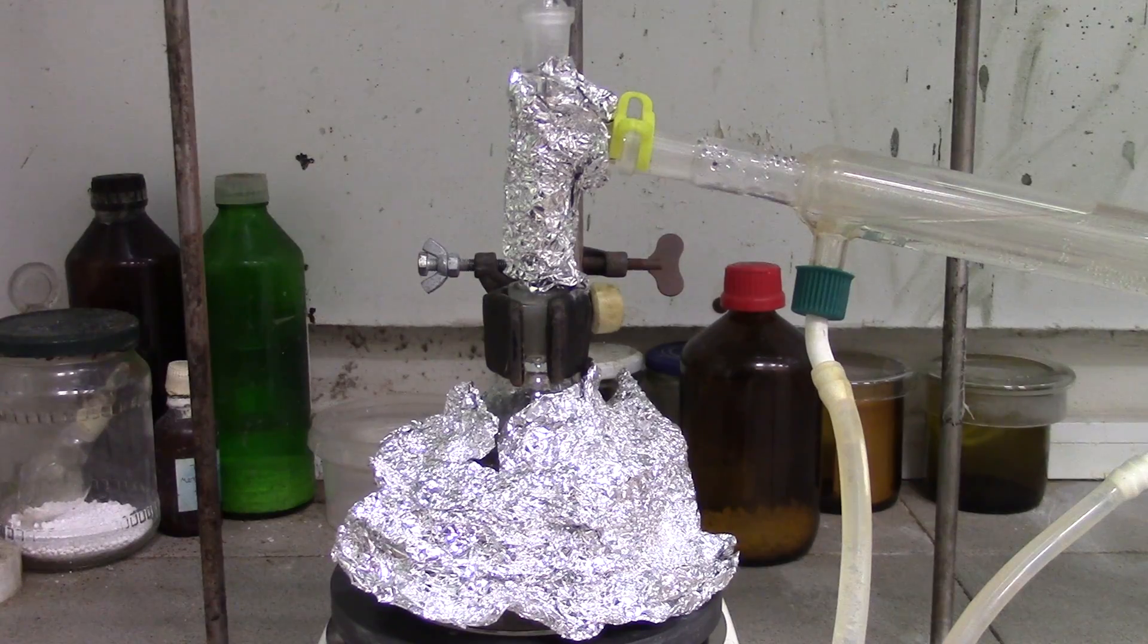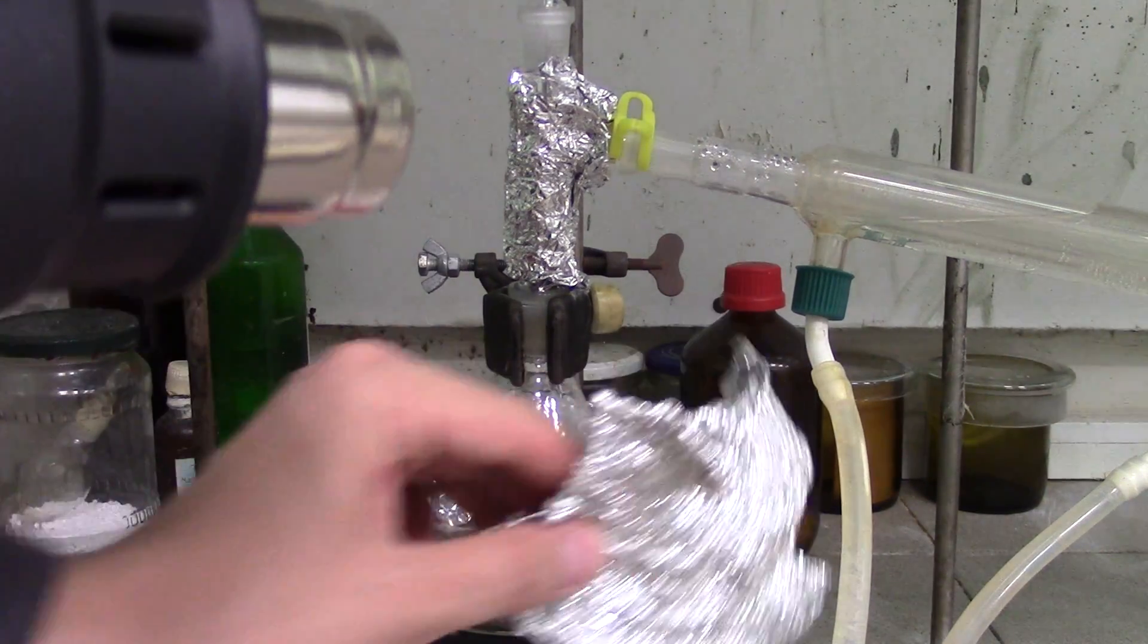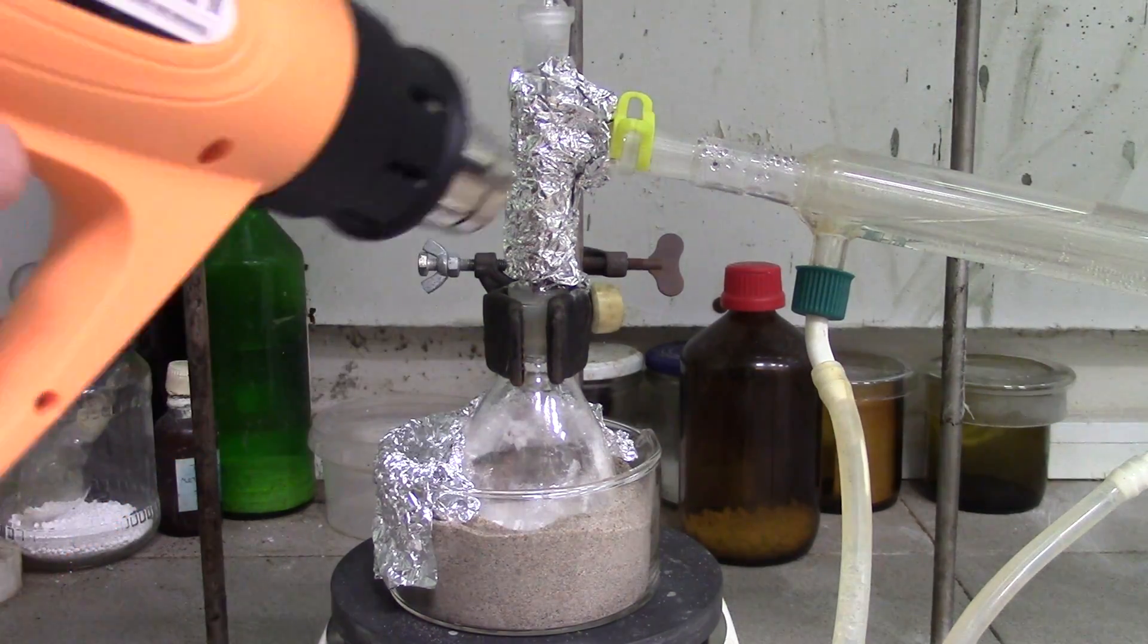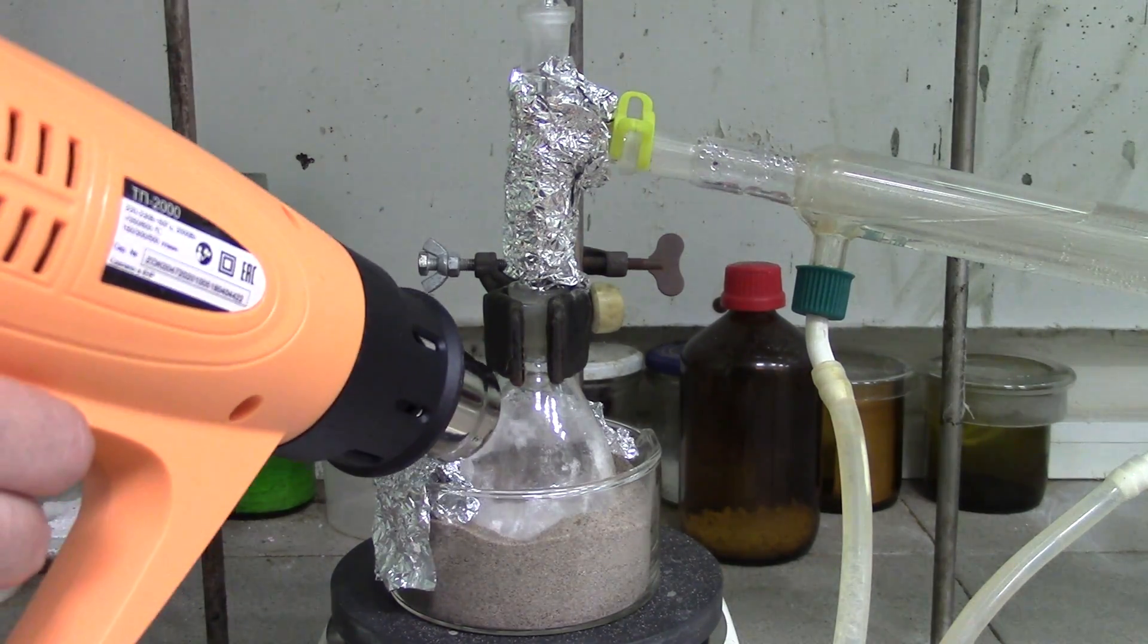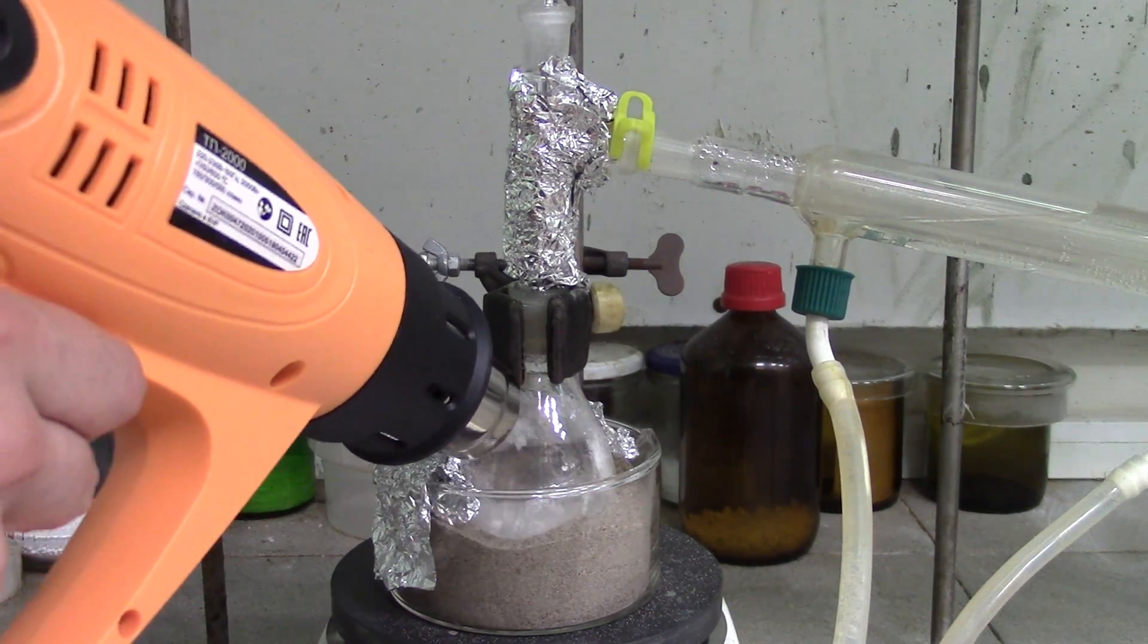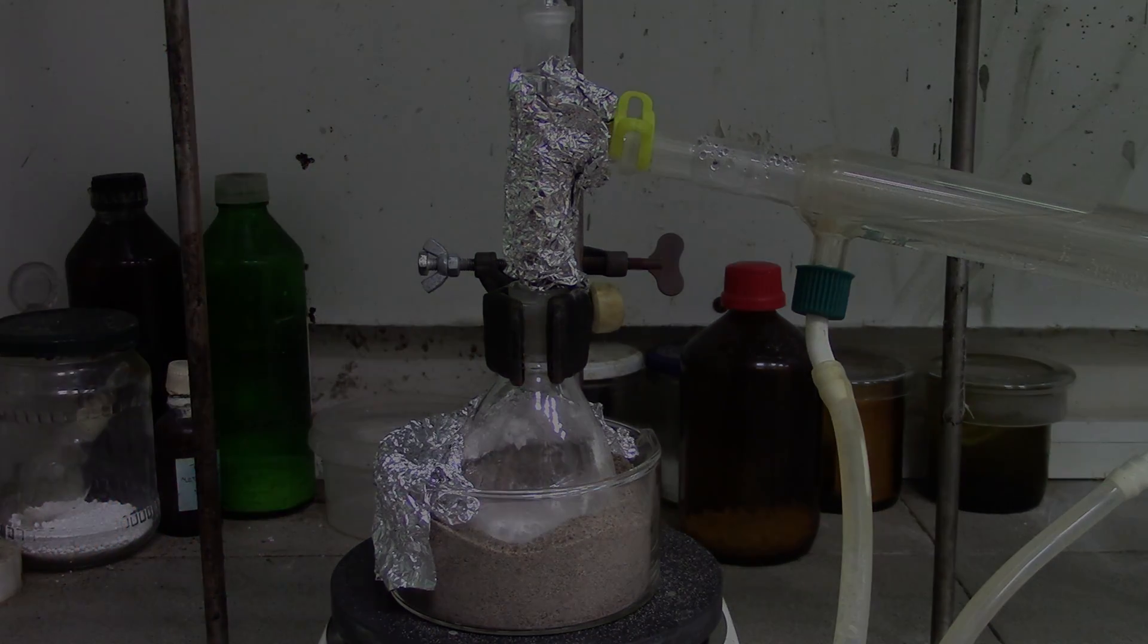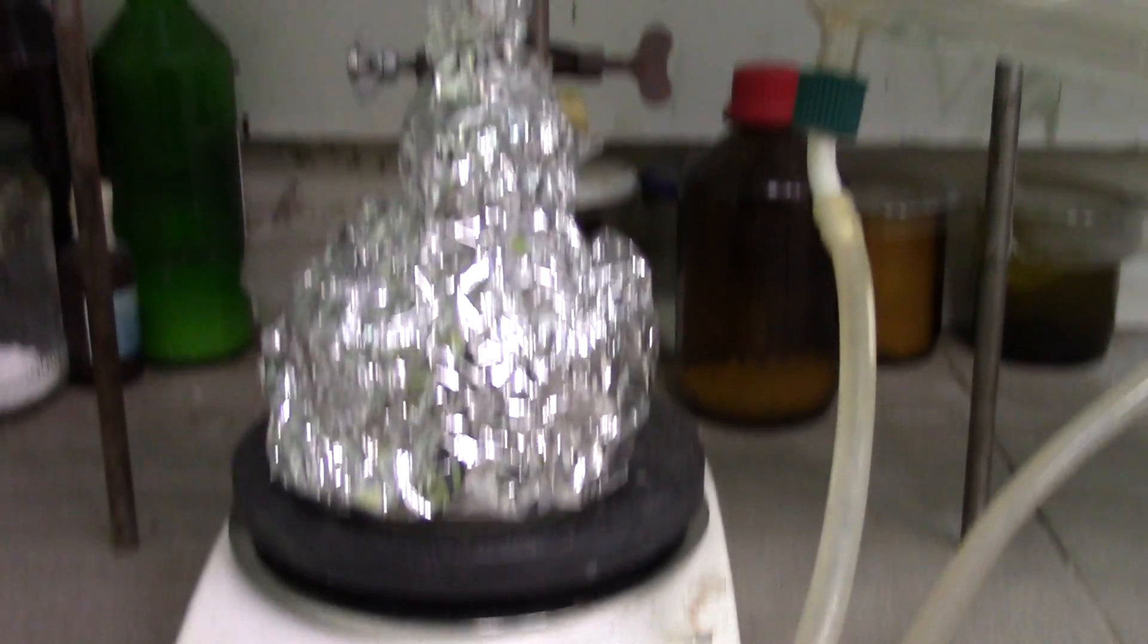Towards the end of procedure, I decided to help a little bit using a heat gun. Reaction stops when the temperature starts to decrease. Turn off the hot plate and let it cool down.